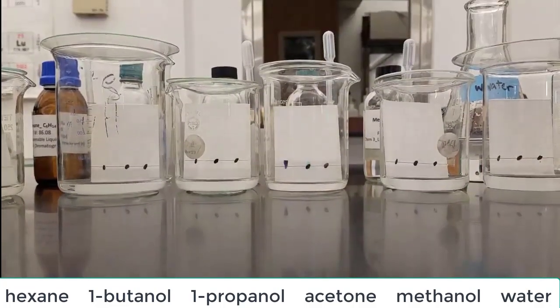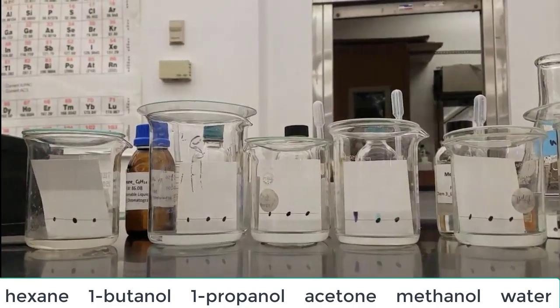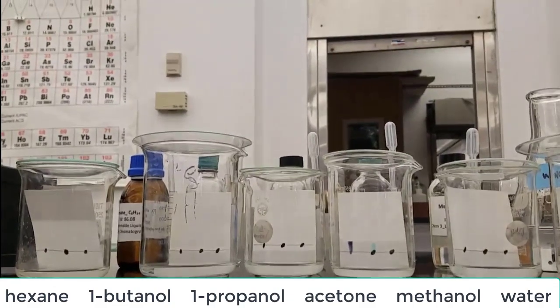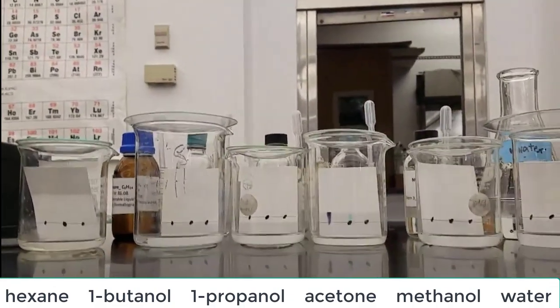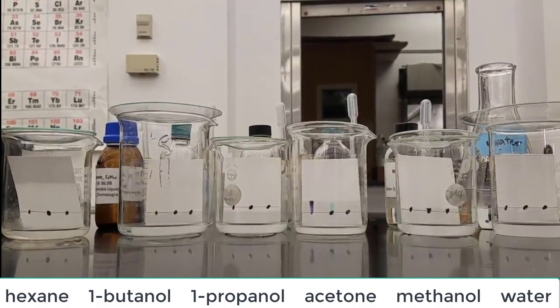That's partly why we keep the lids on. Also it just keeps the fumes trapped inside of the beakers. So this has been sort of time lapsed for you. But as you can see as the liquid moves up over there on the left, the hexane, the inks are not moving with it. That means that the inks are not soluble in hexane.